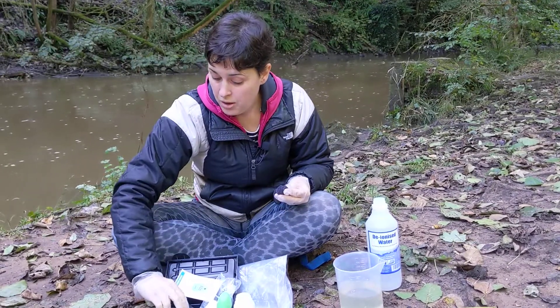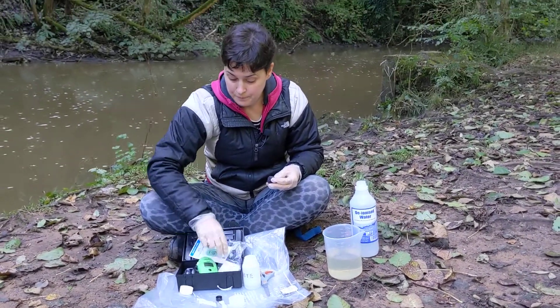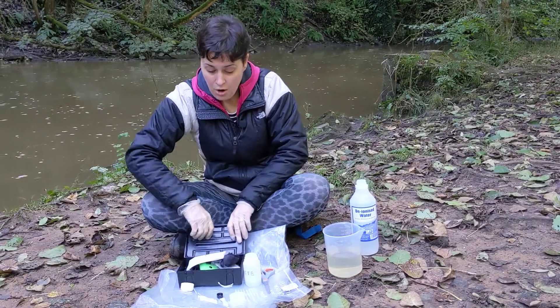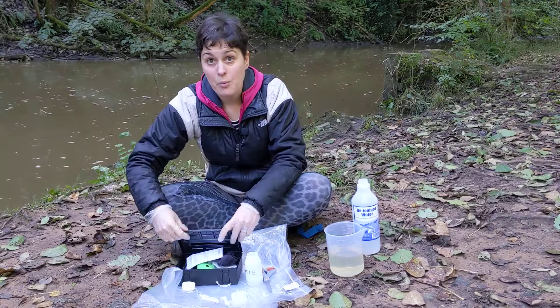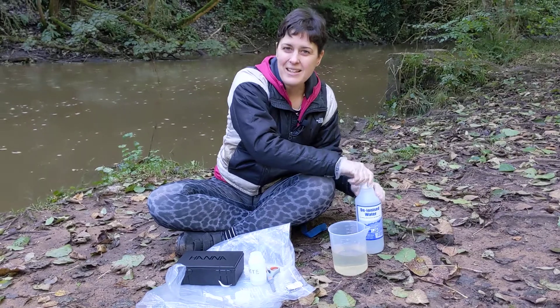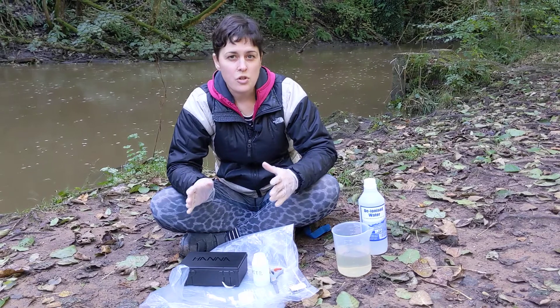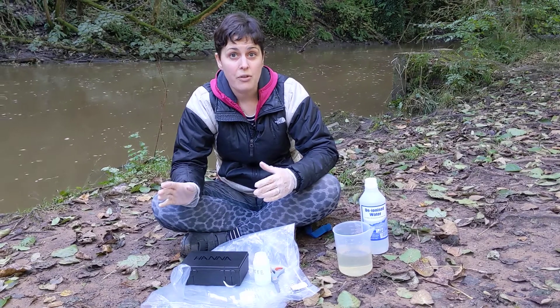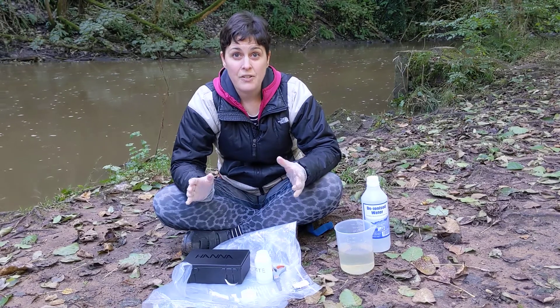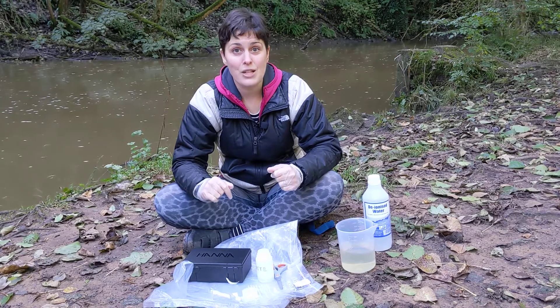When you get home, open the lid of your case so your tubes can air dry. Then pack up your kit ready for your next sample. If the weather's terrible — pouring rain or very windy — try and do it as soon as possible after you get your sample out of the river and find somewhere a little bit sheltered. Your safety and comfort are the priority here. Look after yourselves and thanks for collecting phosphate measurements.